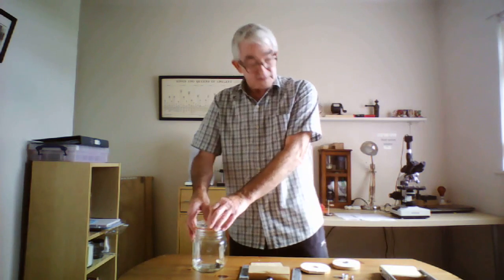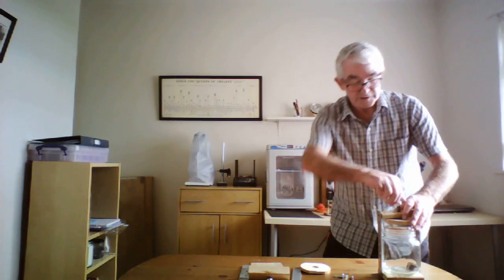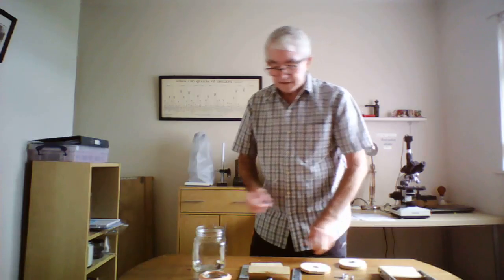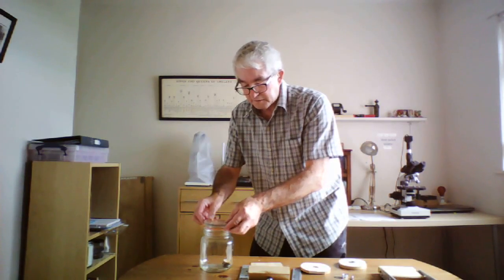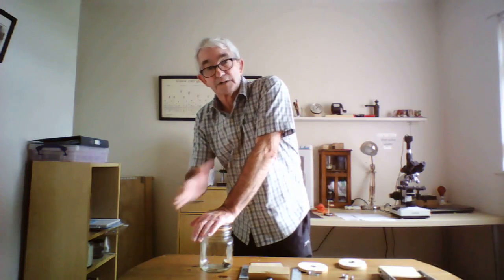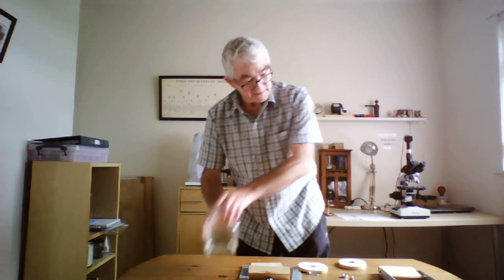When you've got your jar airtight, it's then placed in under here, like this. Put your top on with the hole facing up, and then screw down, reasonably tight. When you're actually making it airtight, I don't use a candle — I use sawdust and ethanol and make a mixture. Then when you've lit it, once you put your sample in — obviously in bacteria — place it on the top and hold it down until the flame has gone out, maybe two or three seconds after. Then you've got your vacuum created. Then you place it on the clamp, put down, screw down, and that's finished.